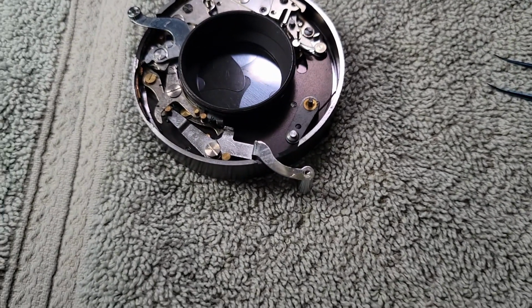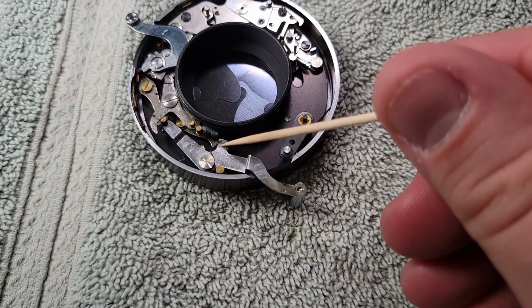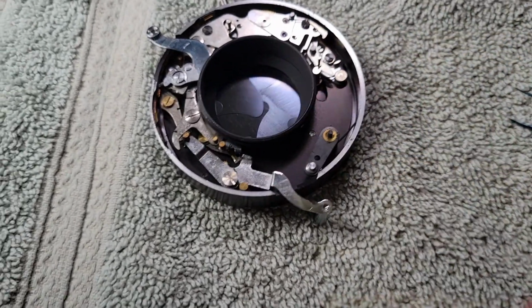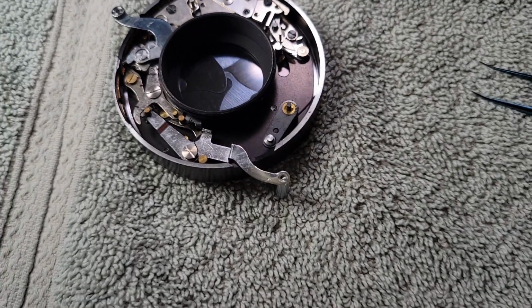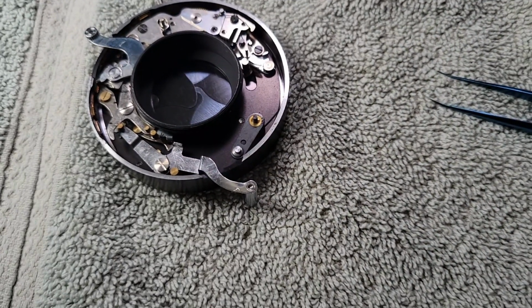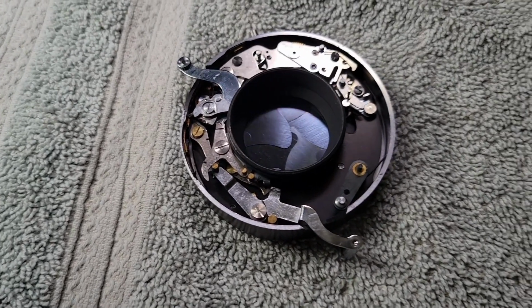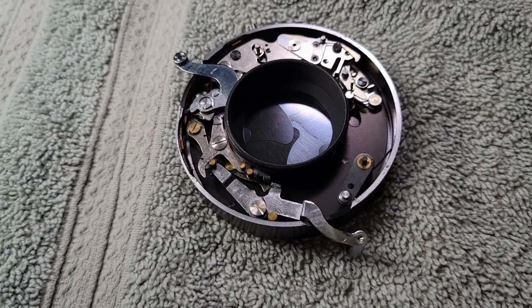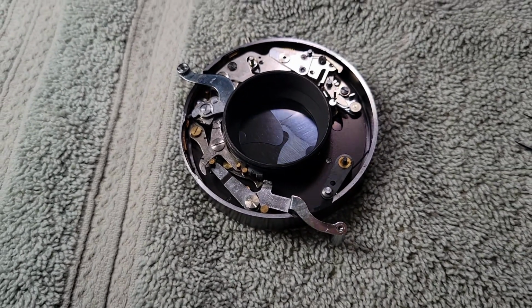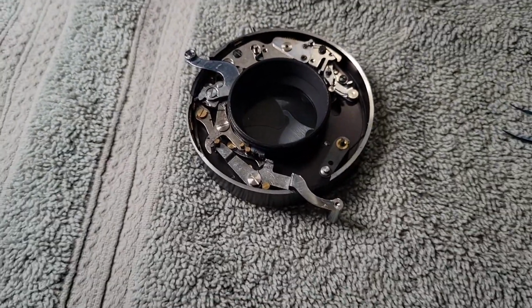The only hope that I have with it is that I understand it enough to know that the issue is with that little pin and that thing there, and not some other part of this. Because if it's some other part of this, I'm out of my depth. I'd probably literally buy a whole new part and hope that it was better. However, I'm going to try and get this fixed tomorrow morning, and then I will film reassembling it, hopefully with actually fresh camera batteries, because doing this without camera batteries is kind of difficult.